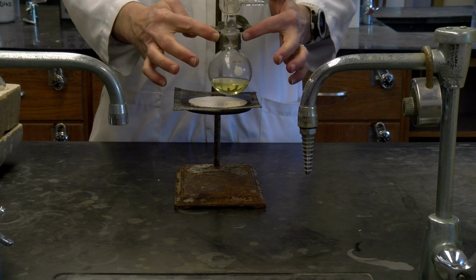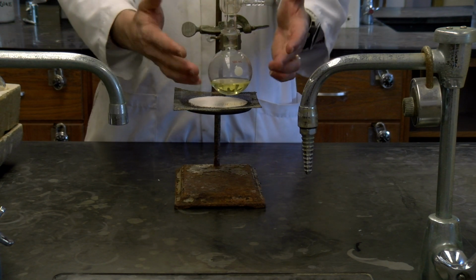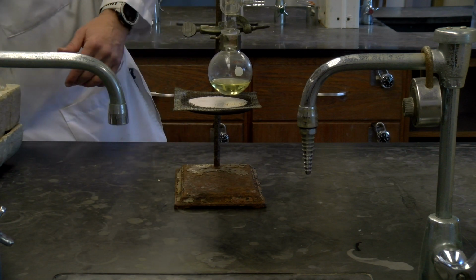second clamp for that. I have a clamp here, and there's no plastic or anything right around here because this is going to get hot once we add the heating mantle.